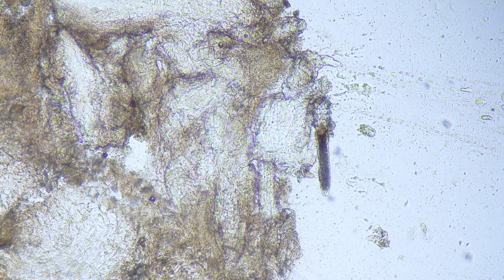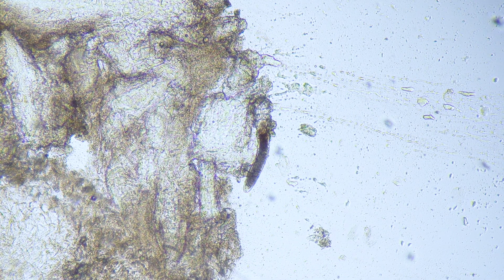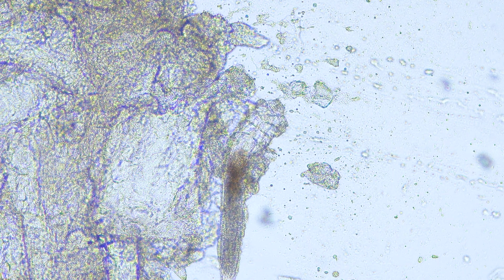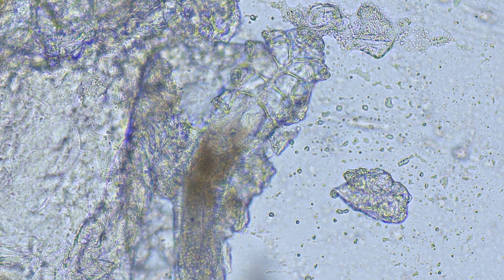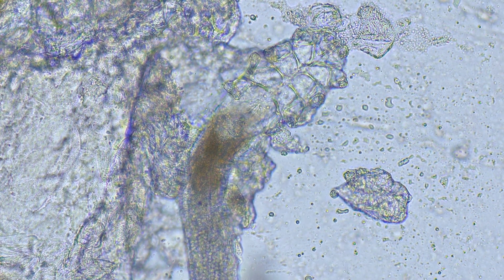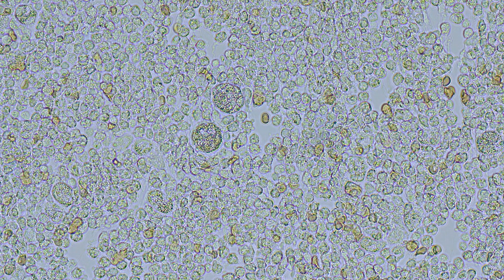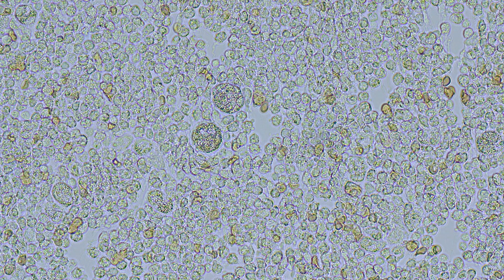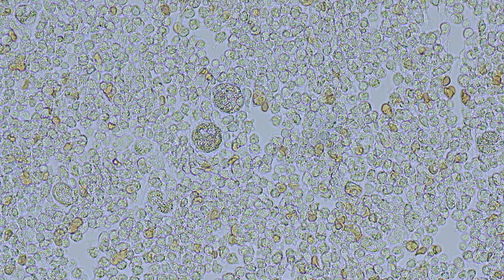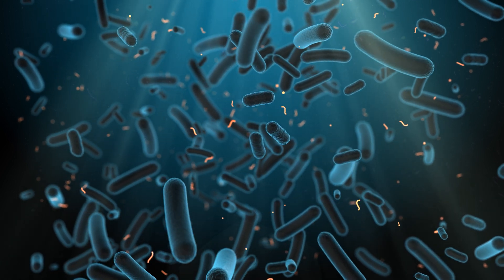When examining inflammatory acne under a microscope at 100 times magnification, we can see a large amount of sebum, dead skin cells, and hair. Look closely — do you see it? A multi-legged creature crawling and wriggling in the debris. Zooming in at 200x magnification, we can clearly see its eight legs vigorously sucking up the debris. At 400 times magnification, we observe blood cells mixed with millions of bacteria. White blood cells are hunting and destroying the bacteria, which are the primary cause of the inflammatory response and acne formation. Cutibacterium acnes thrives, releasing enzymes that break down lipids and trigger inflammation by activating pro-inflammatory cytokines.